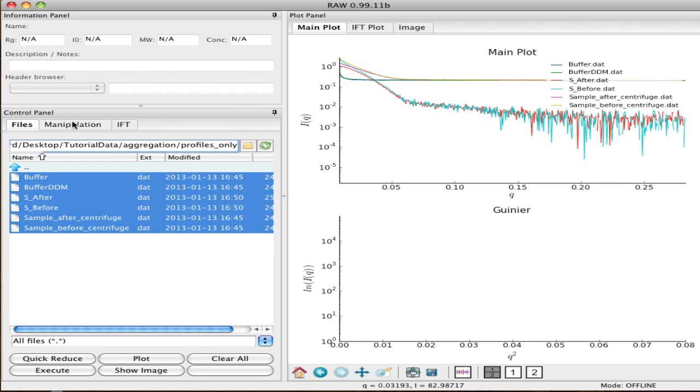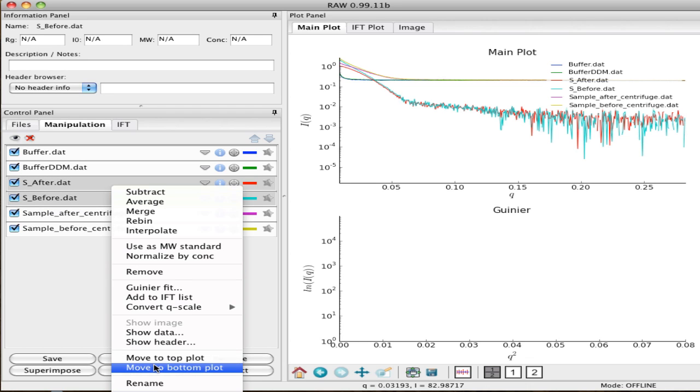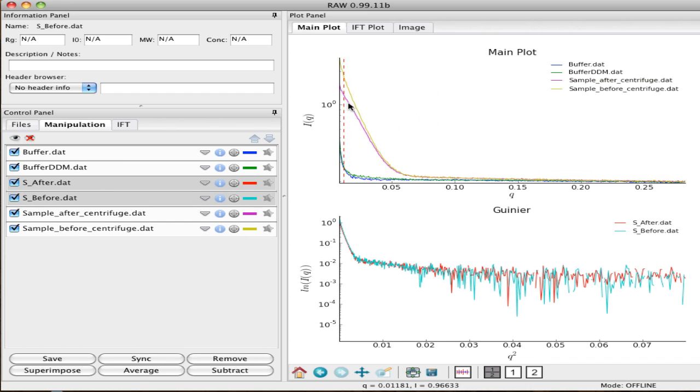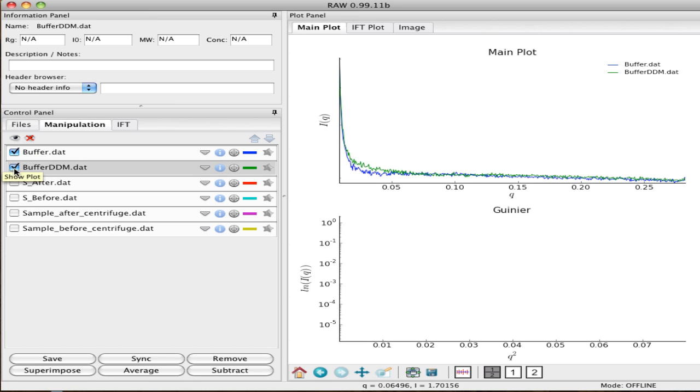Okay, and then go to the manipulation window. What I want to do is take the two that are labeled S_after and S_before, select those two, right click your mouse and go Move to bottom plot. So what I've done is to separate the actual solution and buffer data from the subtracted buffers. Okay, so I'm going to turn everything off except for the buffer and the buffer DDM.